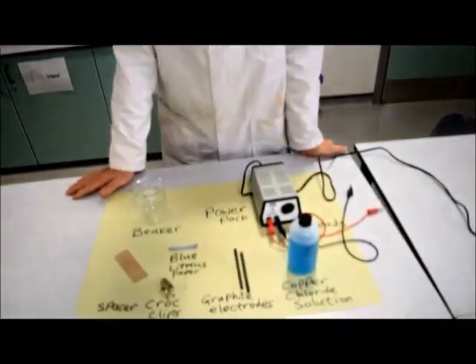Today we're going to look at electrolysis of a solution of copper chloride, and here we have the apparatus for how we're going to do it.